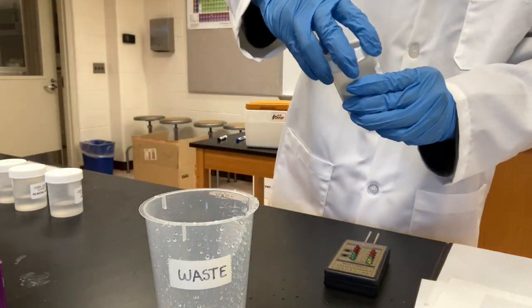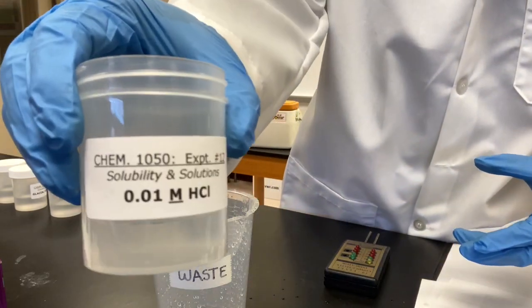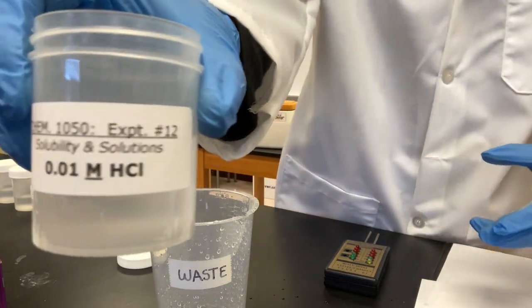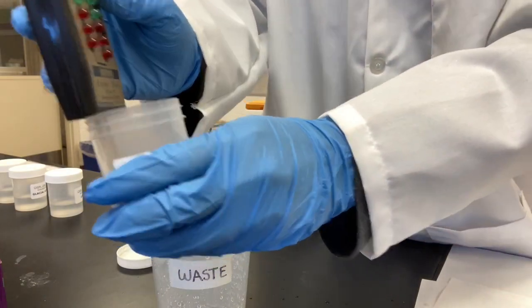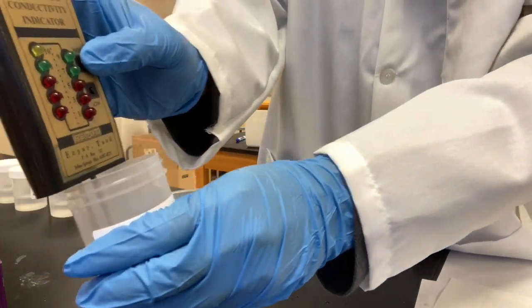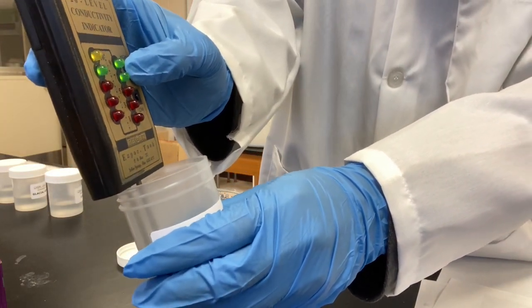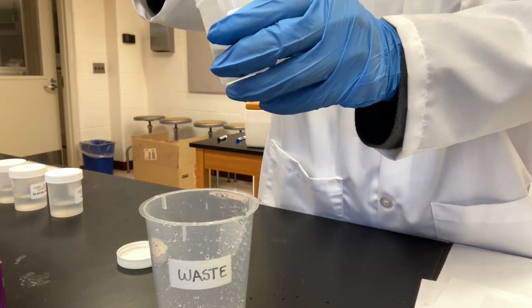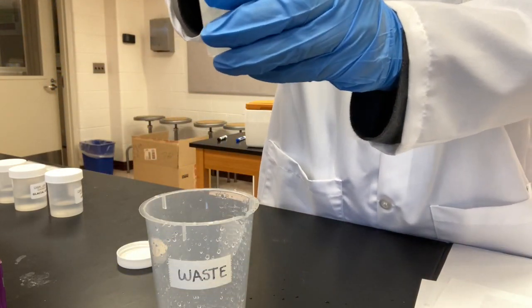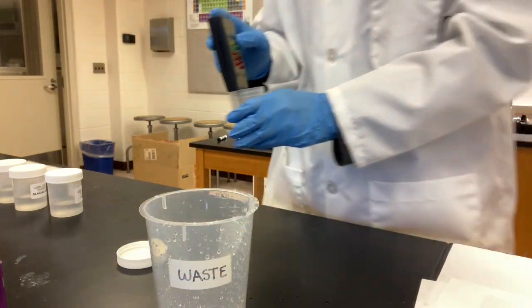Next, 0.01 hydrochloric acid, HCl. High, wow, high 10, it goes to high 10, 7, 8, 9. Let me check. Wow, high 10, it goes to high 10.